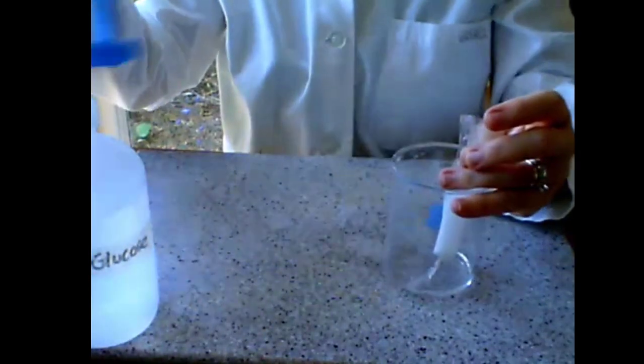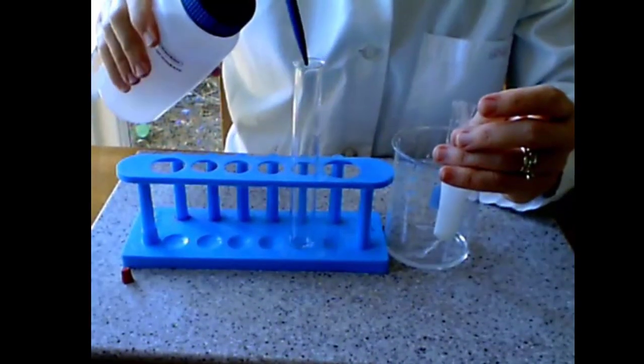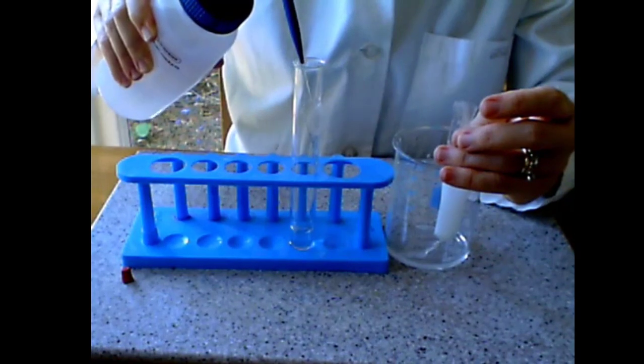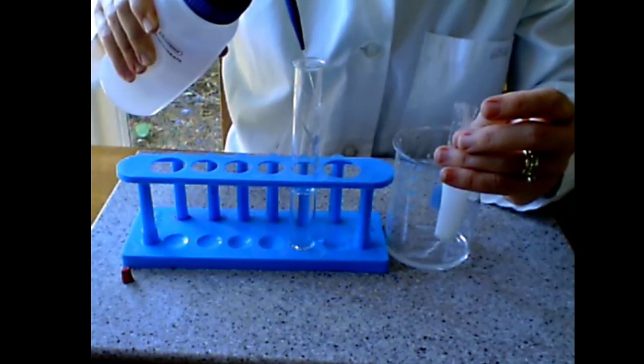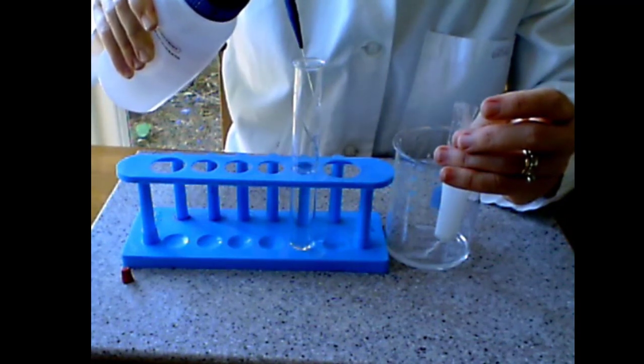Next, we are going to get a test tube. We are going to pour deionized water, which is pure water, into the test tube up to half of the volume of the test tube.